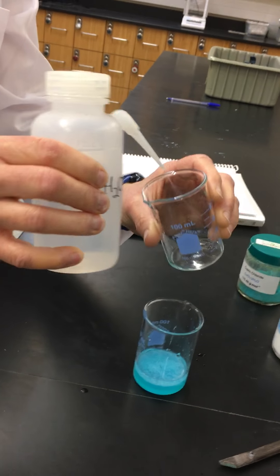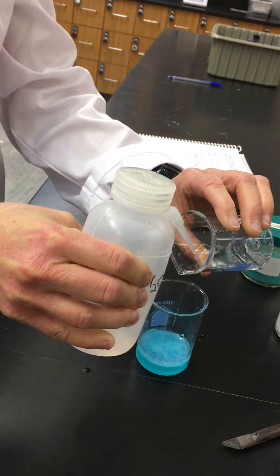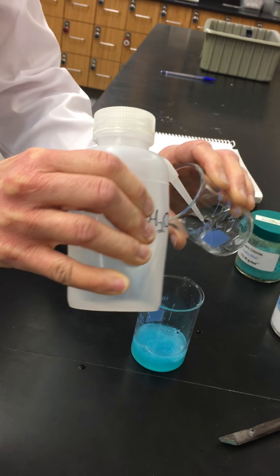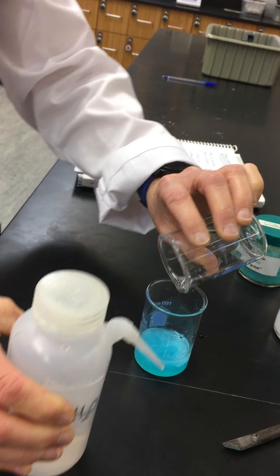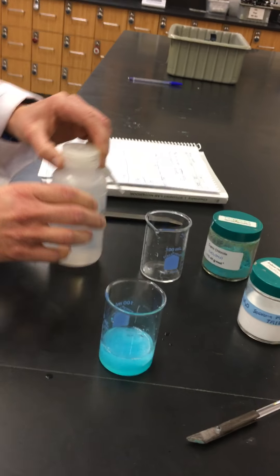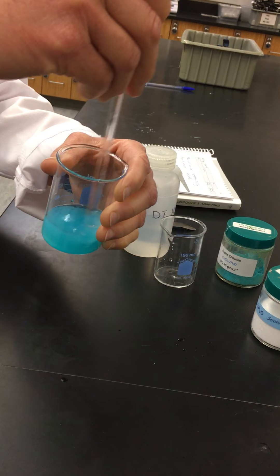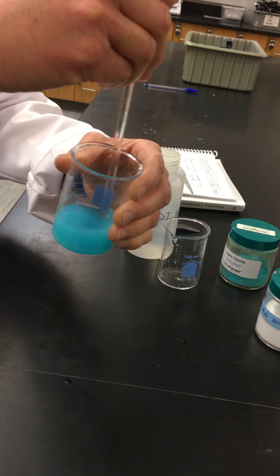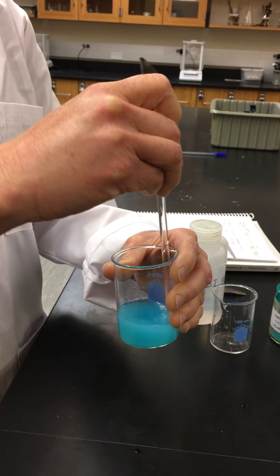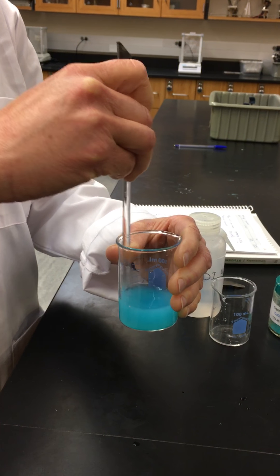We want to make sure that all of the copper chloride was added to our sodium phosphate to ensure that all of it has a chance to react. We'll stir this for a couple minutes just to make sure that all the copper chloride and sodium phosphate have a chance to react with each other.